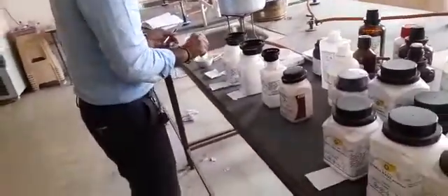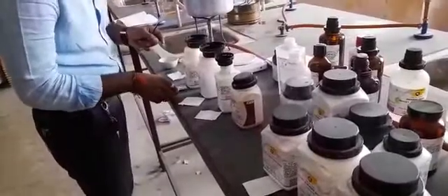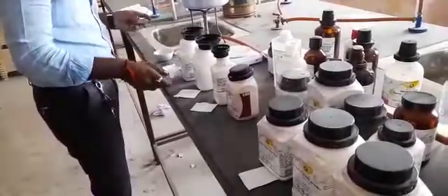First, weigh all quantities of substances in ascending order and add them into the porcelain dish. After adding all the substances in ascending order, mix them properly using a spatula.